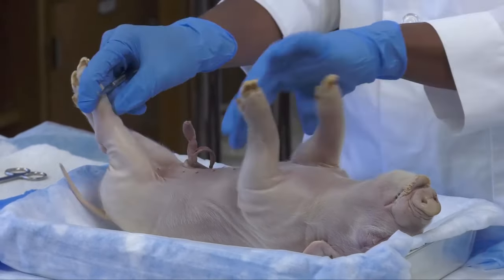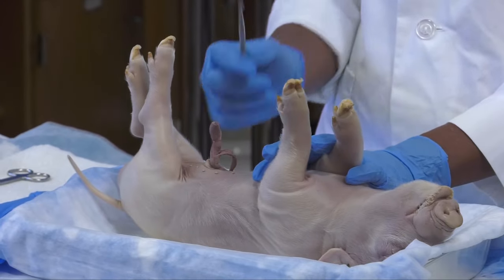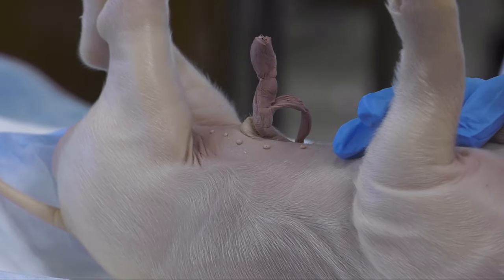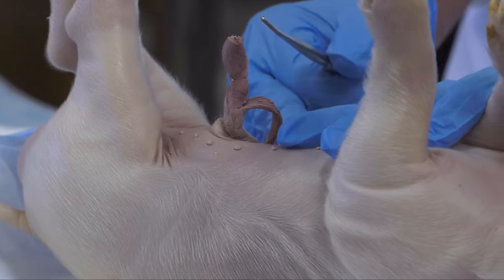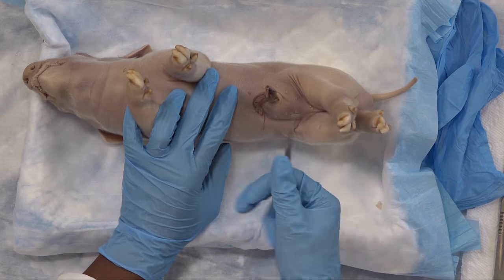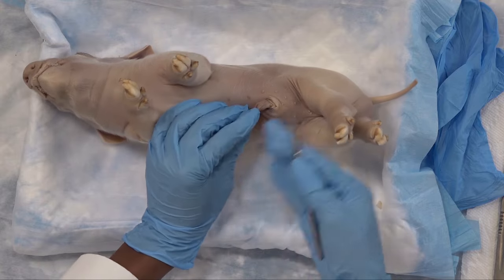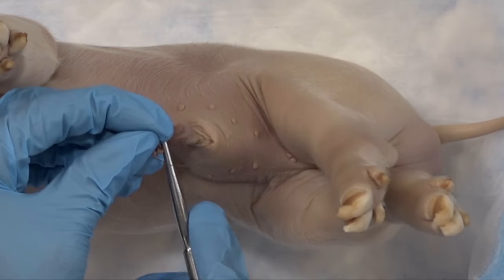Now let's turn our pigs so they are ventral side up — belly side facing you. You'll start to see teats or nipples. Students might flip their pig over and say they have a female just because they see nipples, but pigs, whether male or female, will have these structures just like human males have nipples. In females, these would transition into mammary glands and allow for milk production to be provided to the young. We also see the umbilical cord here.